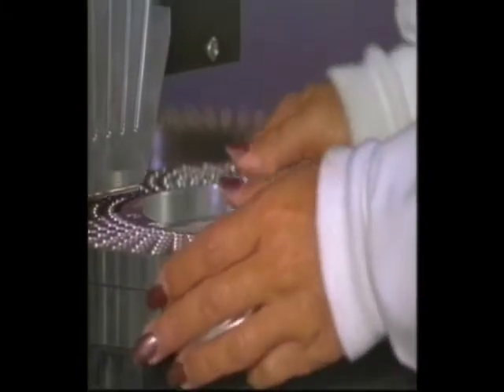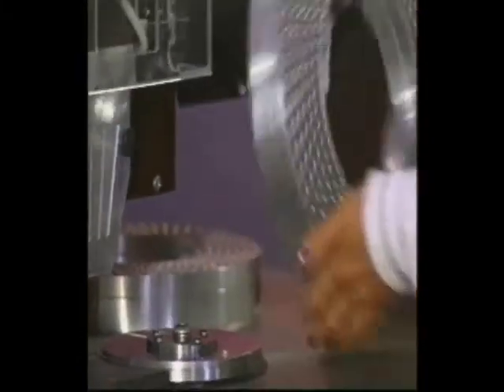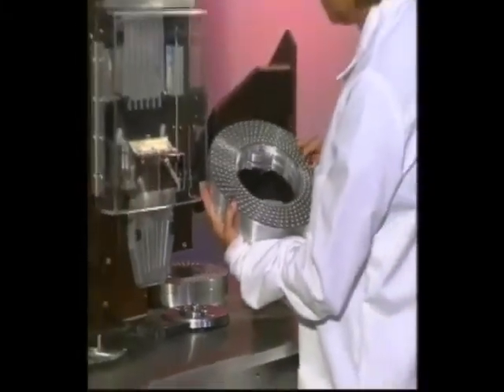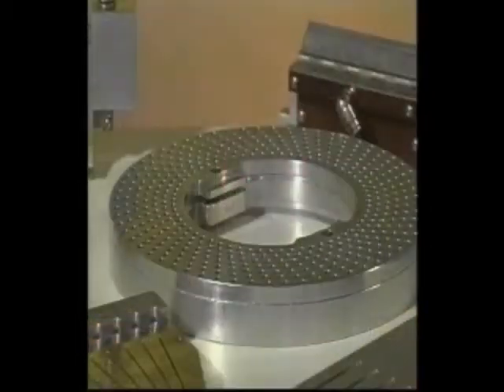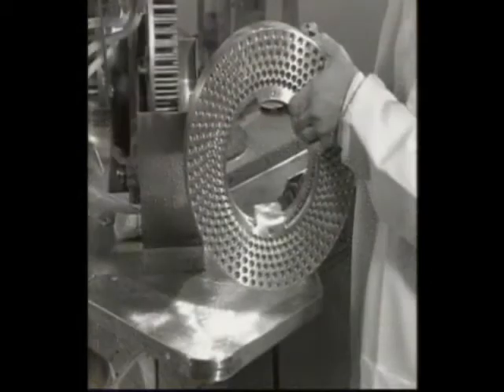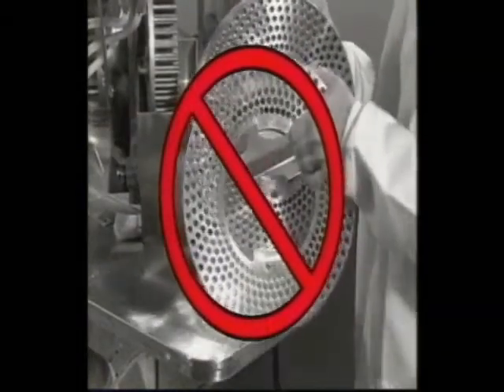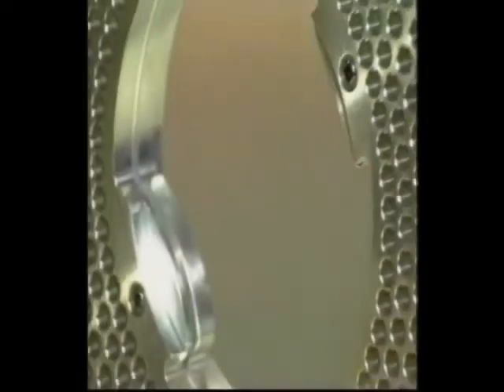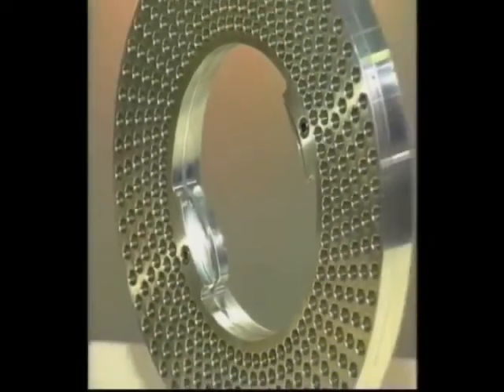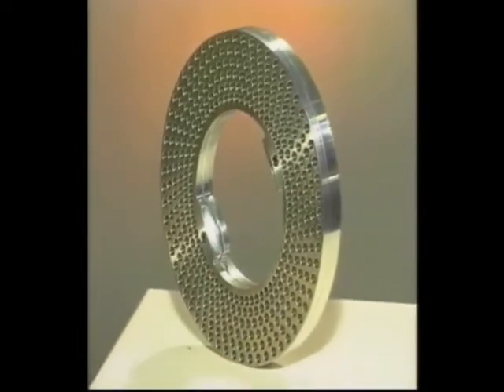Because you will be handling it more often than any other part of your machine, your filling ring is perhaps the most important component of your Model 10. It is made of aluminum and is fragile. Be sure not to bang either half of the ring against any of the stainless steel surfaces on your table or against each other. It can easily dent, and using dented rings will affect your vacuum and filling processes.